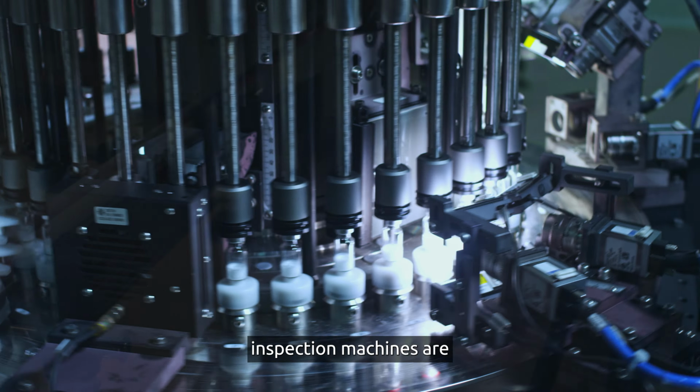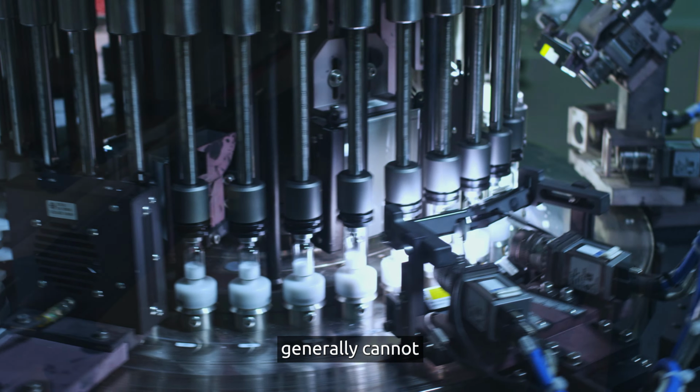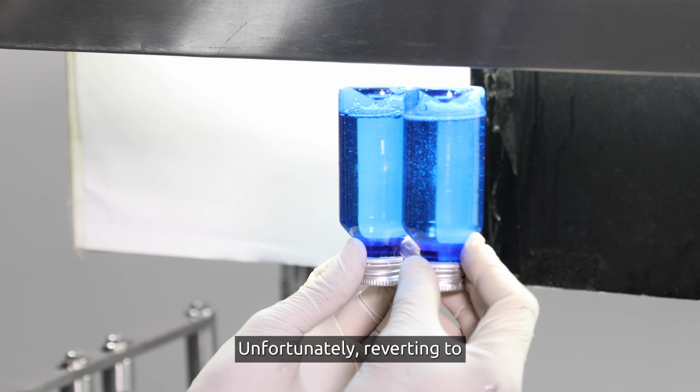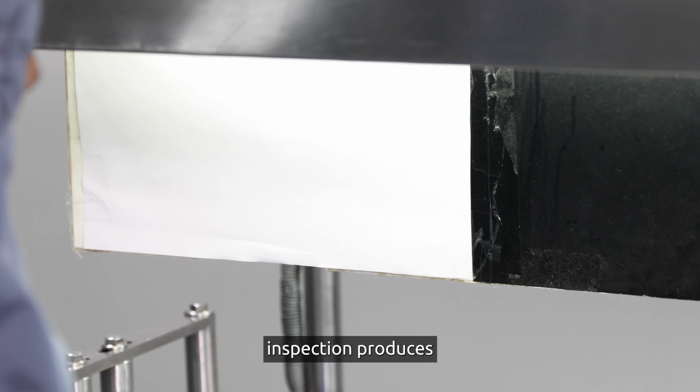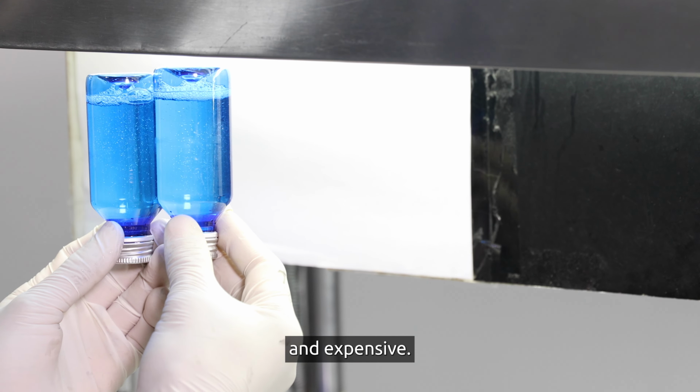Traditional high-speed inspection machines are difficult to qualify, and they generally cannot be used for these types of difficult to inspect products. Unfortunately, reverting to human visual inspection produces inconsistent results, and it's slow and expensive.